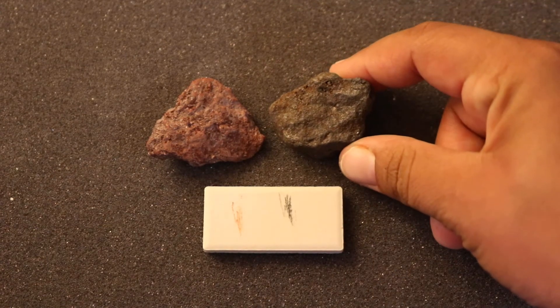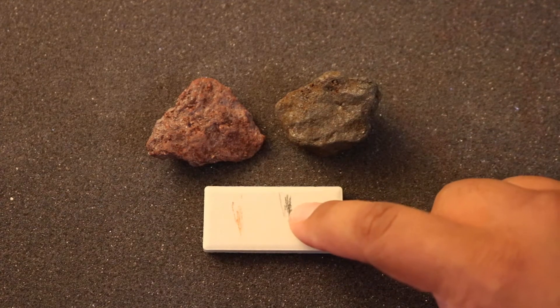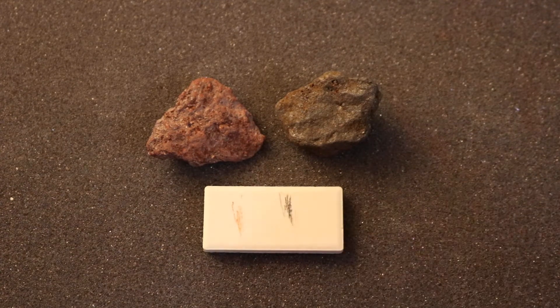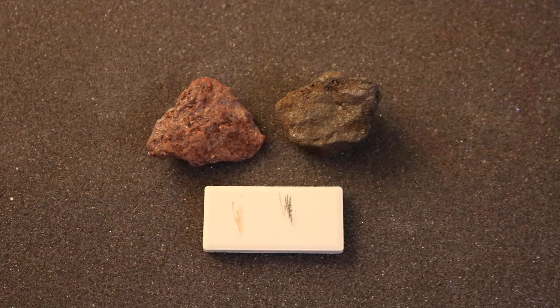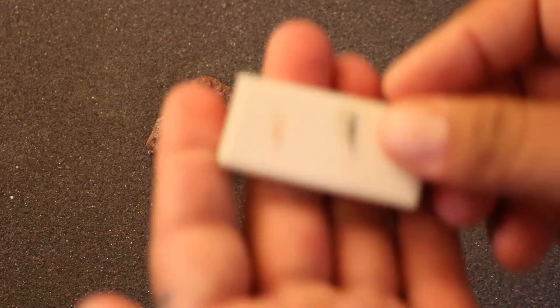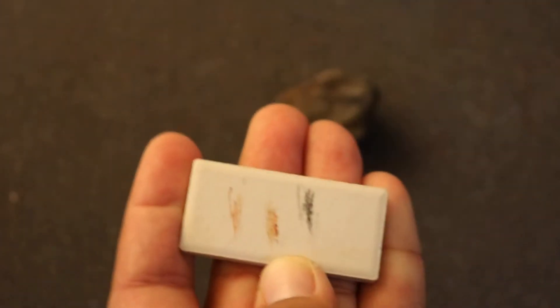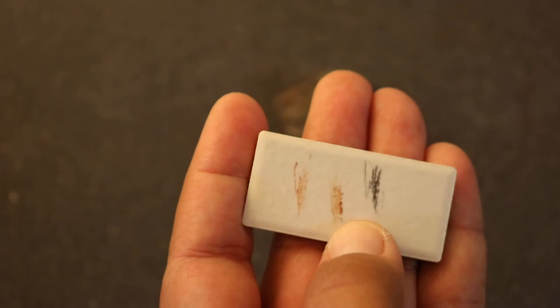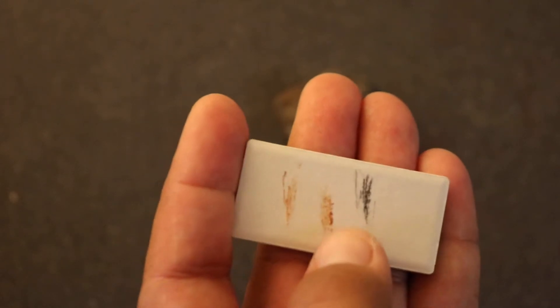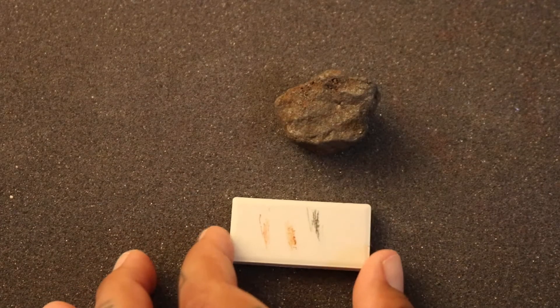This piece of magnetite, which is dark gray, has a streak that is dark gray and black. So essentially what you do in order to test a streak is you take your streak plate and your mineral and you just scratch it onto that streak plate. Then you note the color of the residue that is left on the porcelain plate afterwards.